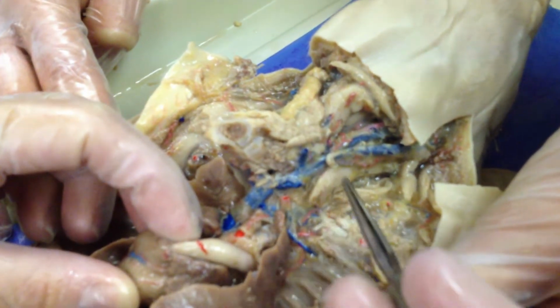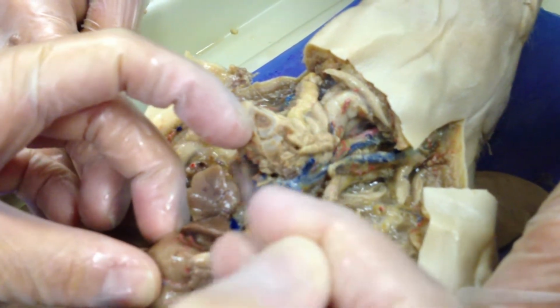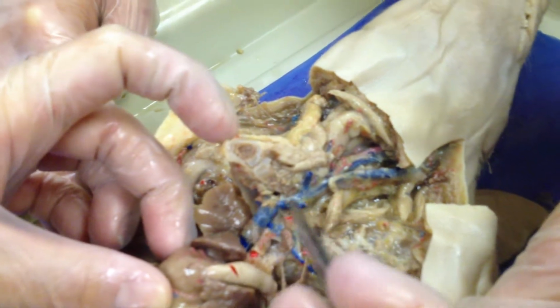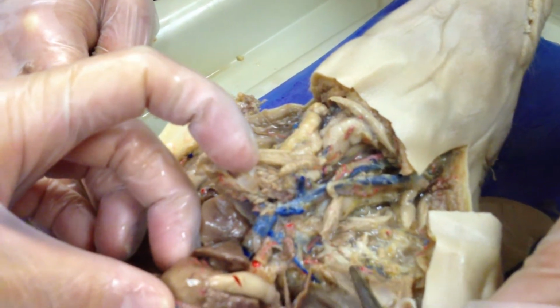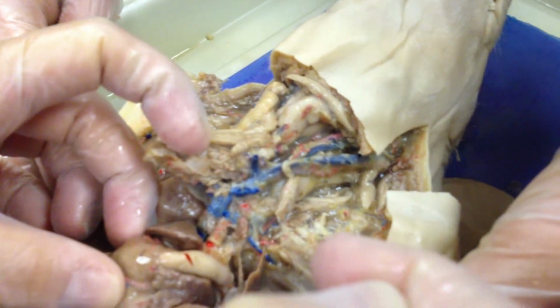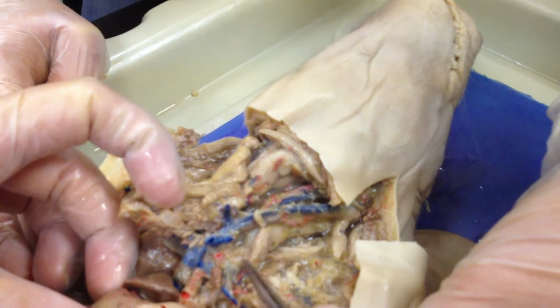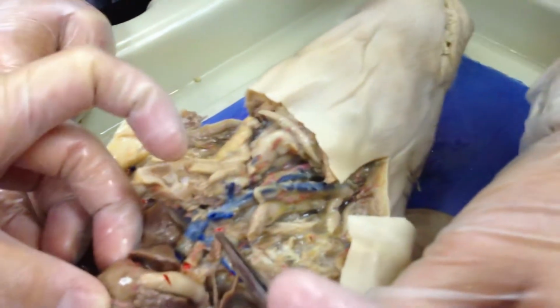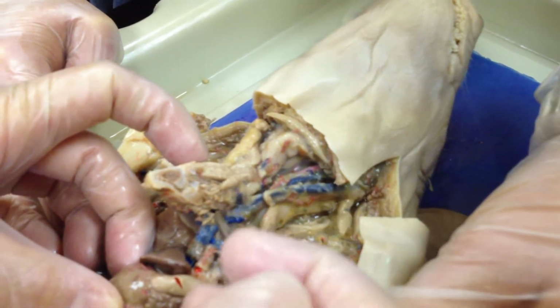So your brachiocephalic vein is going to come in, and they're going to feed into your superior vena cava here. So this is your brachiocephalic, and you can see, if we hadn't cut it, and that was my fault too, that it went right over here down to the subclavian and then up to the head. Brachio, arm; cephalic, head. So the brachiocephalic vein is your arm-head vein, the one that's going to give both of those.